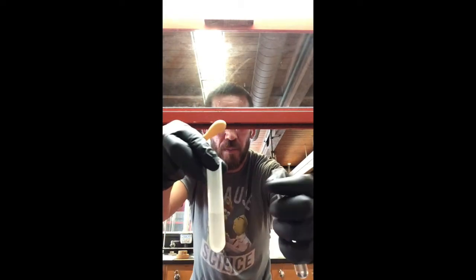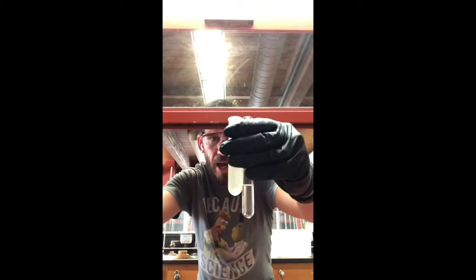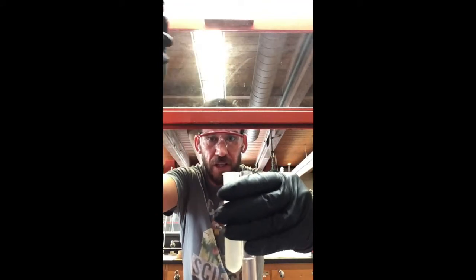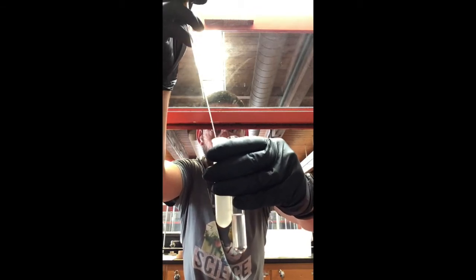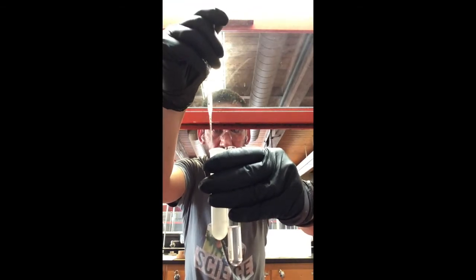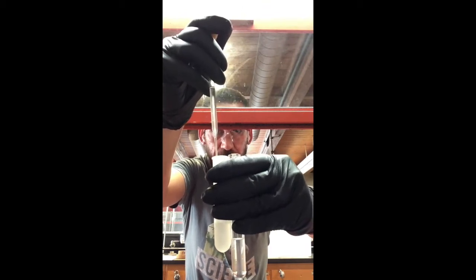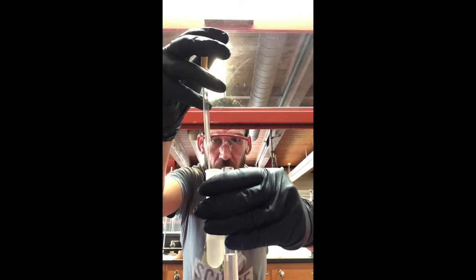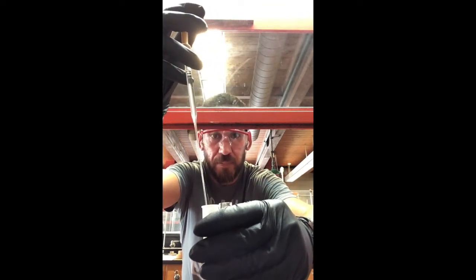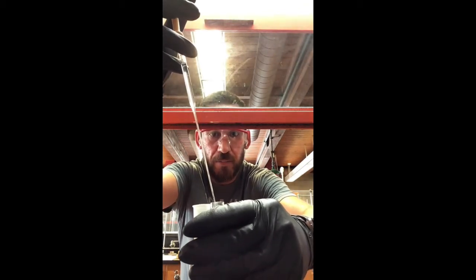So, here we go. Remember, holding these with one hand, side by side, so that when I'm transferring the methylene chloride, I don't have to travel a far distance, and I can minimize the spillage. Squeezing the pipette tip, get in there, extracting the methylene chloride, getting that sucked up into the pipette, and go ahead, boom.